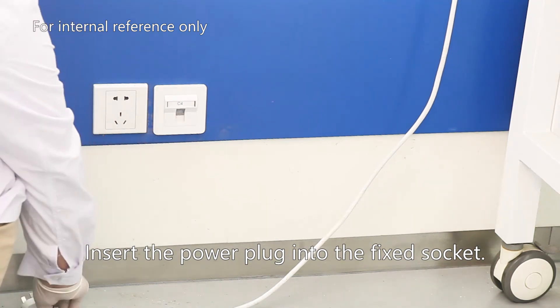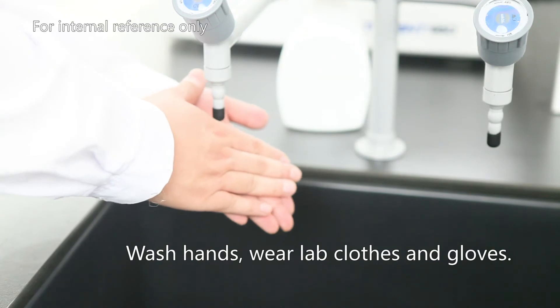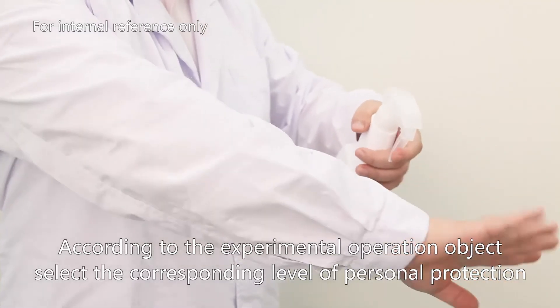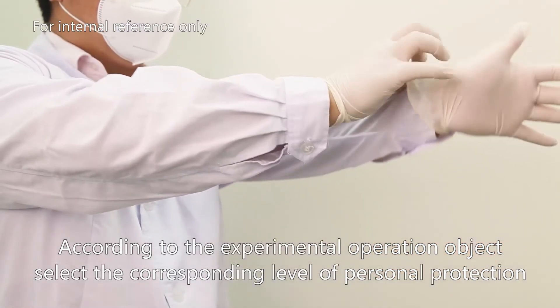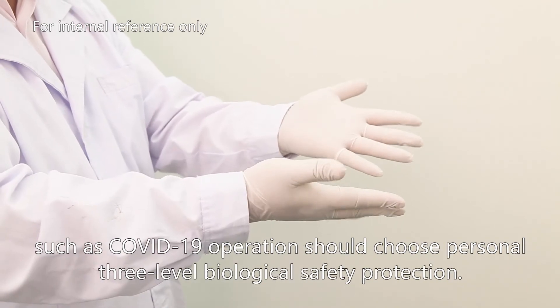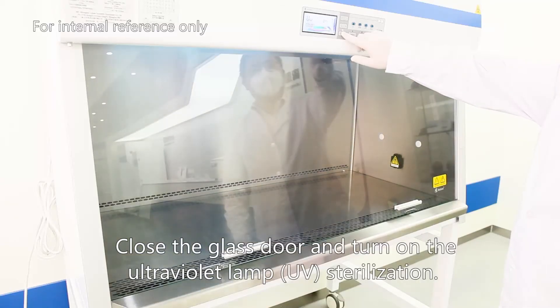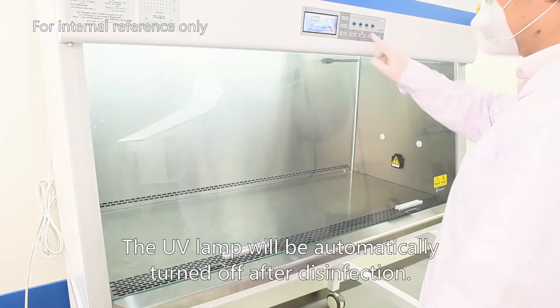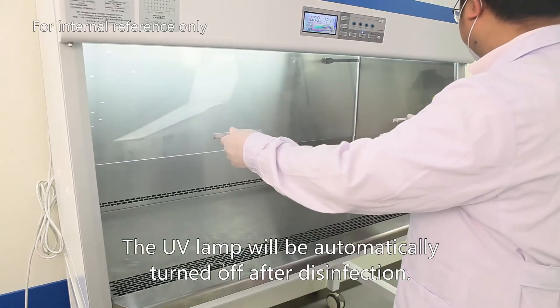Insert the power plug into the fixed socket. Wash hands and wear lab clothes and gloves. According to the experimental operation object, select the corresponding level of personal protection, such as for COVID-19 operations. Close the glass door and turn on the UV lamp for sterilization. The UV lamp will be automatically turned off after disinfection.